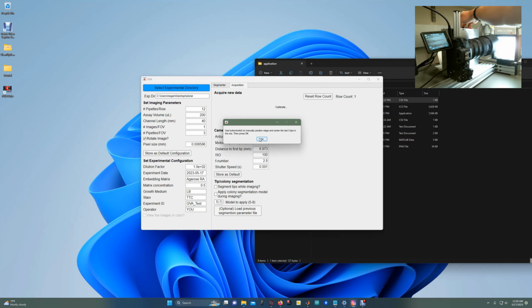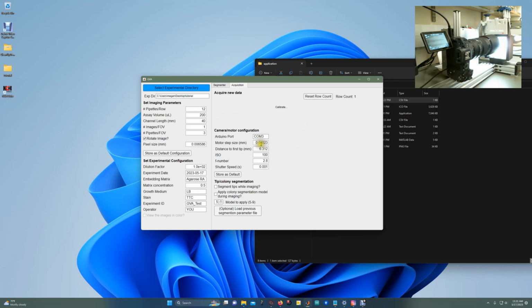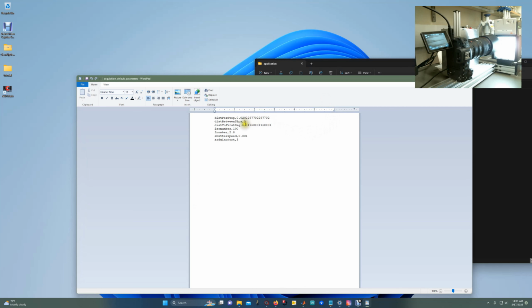And it's going to re-enable the button so that I can move to the last 3 pipette tips in the row. So it's the end of the box. Too far. Right there. So now I've covered both ends of the pipette tips. I'm going to click OK. You see this auto-populates what the step size of the motor is, as well as the distance to the first tip. So now when I click Store as Default, this is stored in that table that came with the experimental directory. So it's the distance to the first image and the distance per step right there.